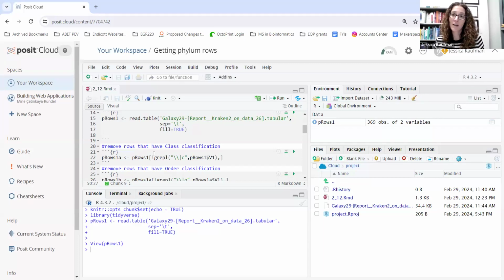This week, it's going to be looking for phylum. Next week, you're going to pick your own classification. So you might do this assignment again to look at genus, class, order, family, any of the other levels of taxonomy. Because the organizational level after phylum is class, removing class is the fastest way to get rid of most of the rows. So I'm going to run that chunk.